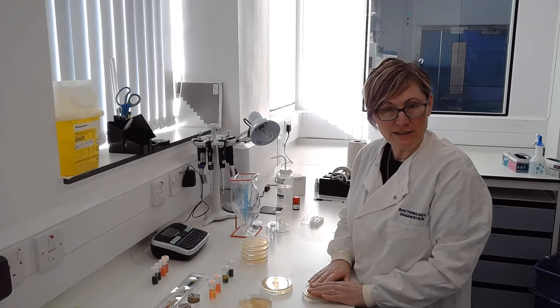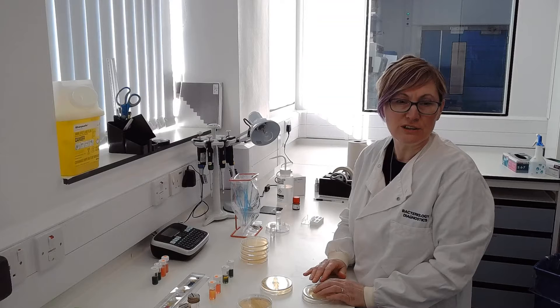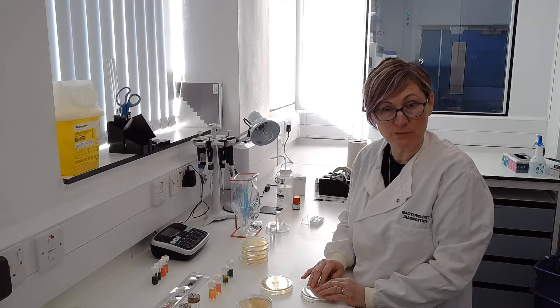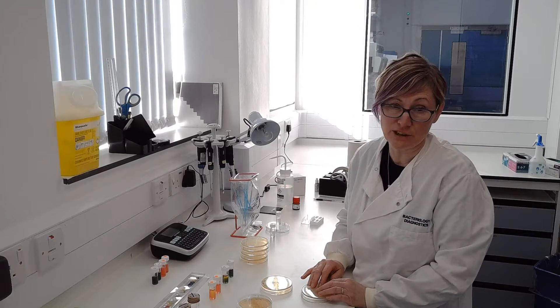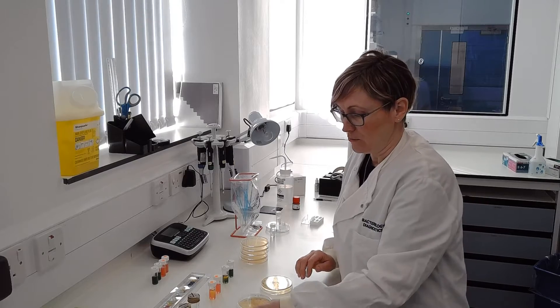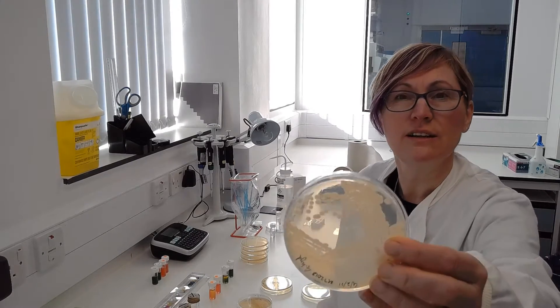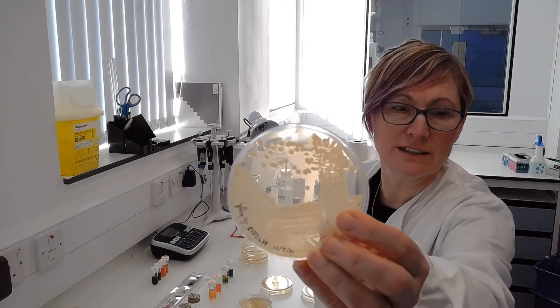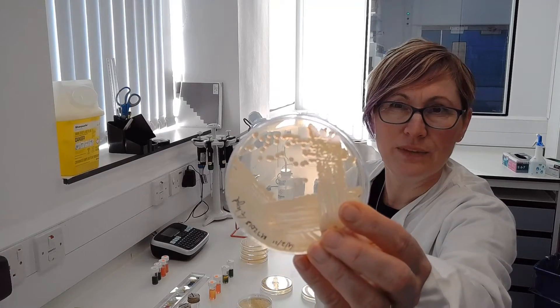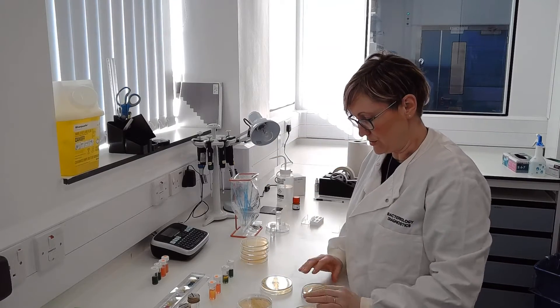That will be incubated for 24 to 48 hours usually, sometimes even up to six weeks for some of our bacteria to grow. But once it has grown, we should have a pure culture — all the colonies look the same — and then we can continue our work on those.